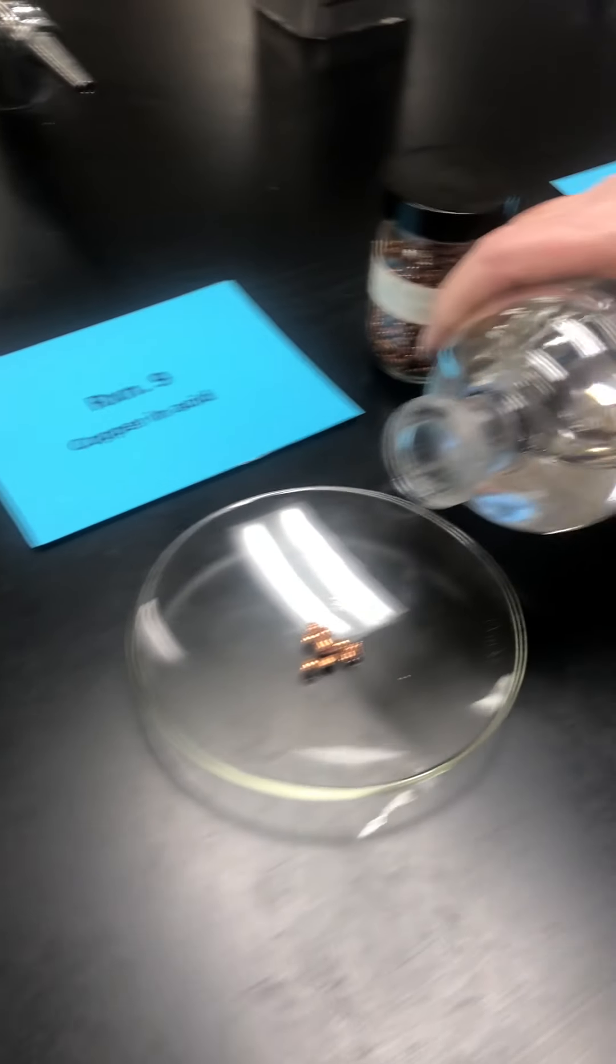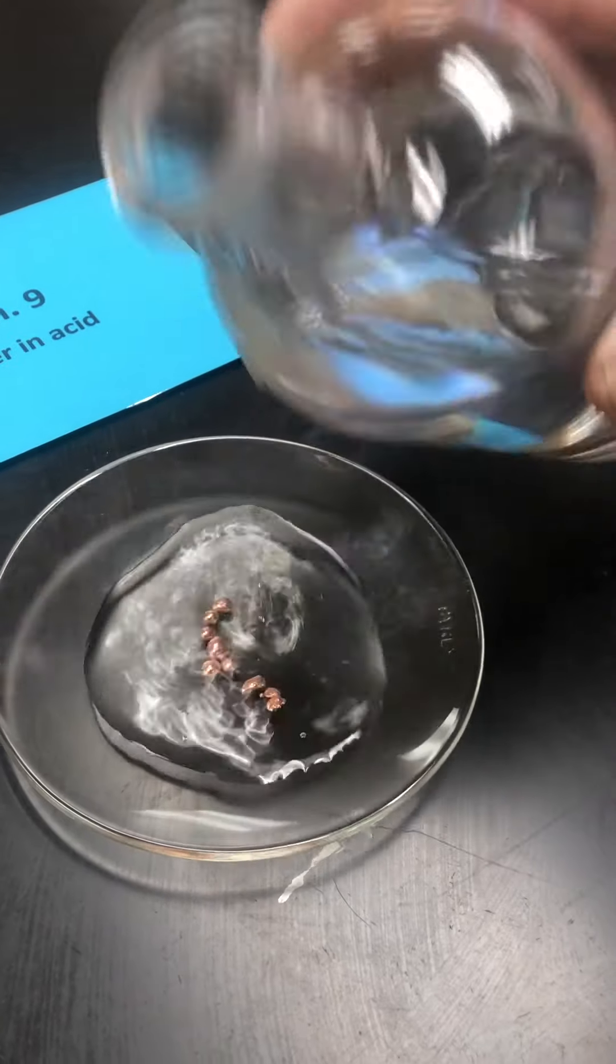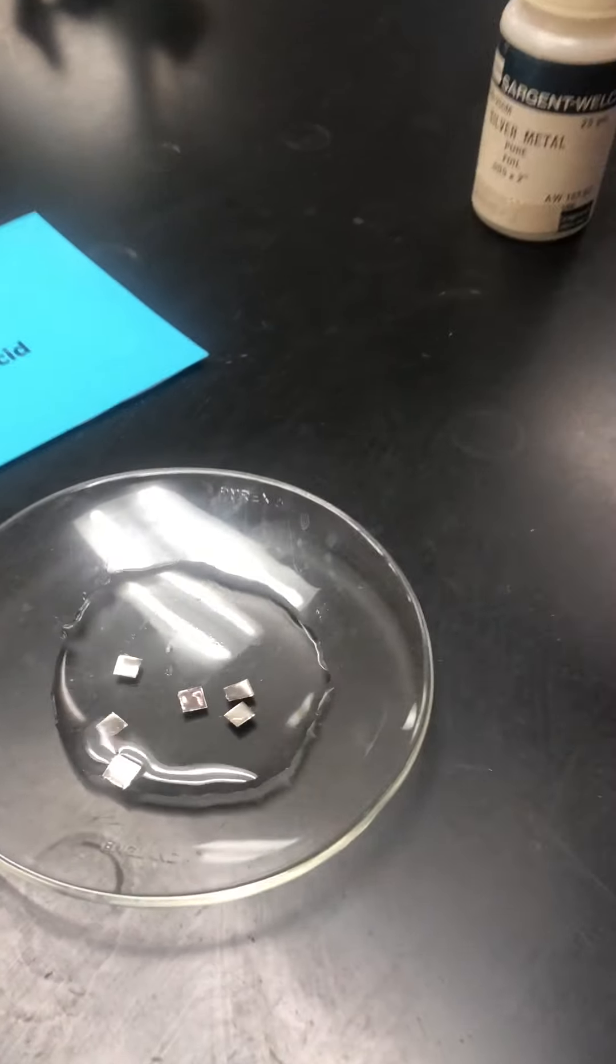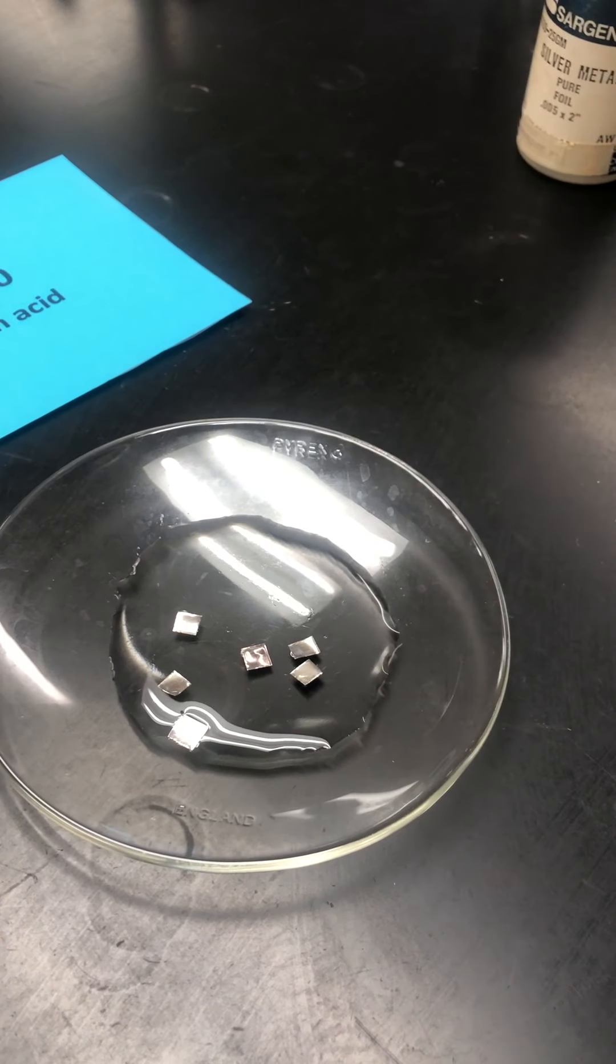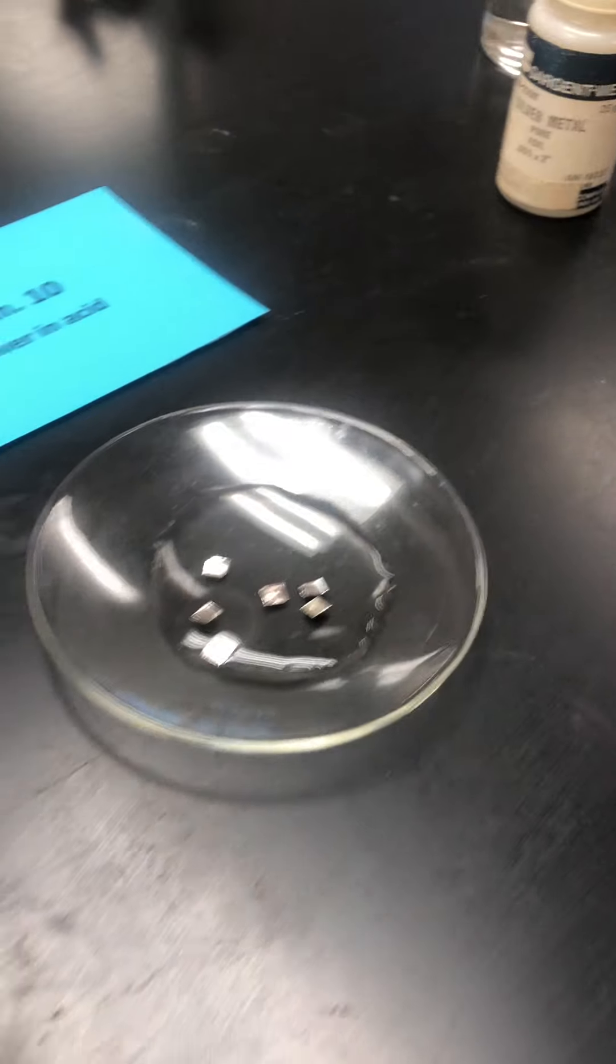Here is the hydrochloric acid added to the copper, and here is the hydrochloric acid added to the zinc. Excuse me, silver. Thank you. Hydrochloric acid added to the silver.